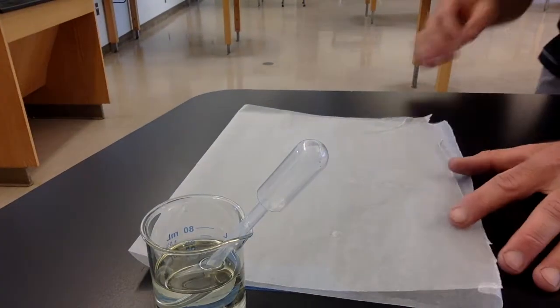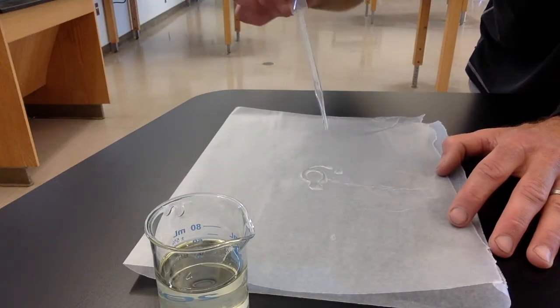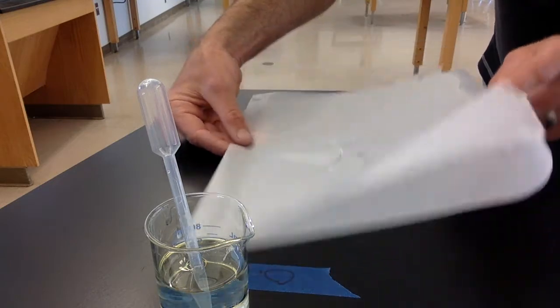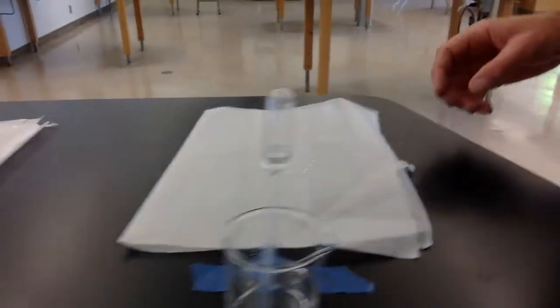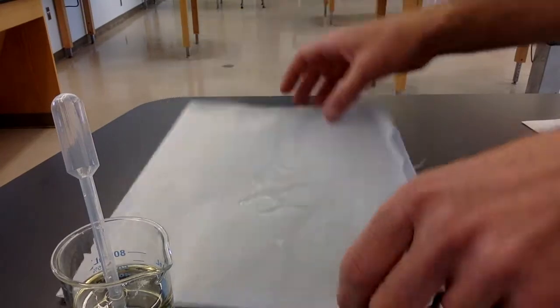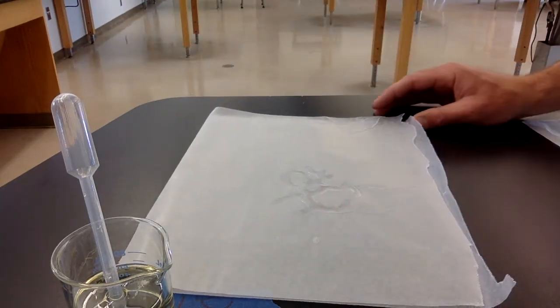And then we'll do the same thing over here with oil. So there's a beaker with oil in it. I'm going to do the same thing. I'll put about the same amount of oil on the wax paper, and then we'll try to let it slide around. It moves a lot slower. And then you can also see it just spreads out on its own. It doesn't stay clumped up. So the water again over here, when I move it around, it has one big droplet of water. It all slides together. And then the oil moves a lot slower, and it just spreads out. It doesn't really stick together. It just spreads out and forms a sheet across the wax paper.